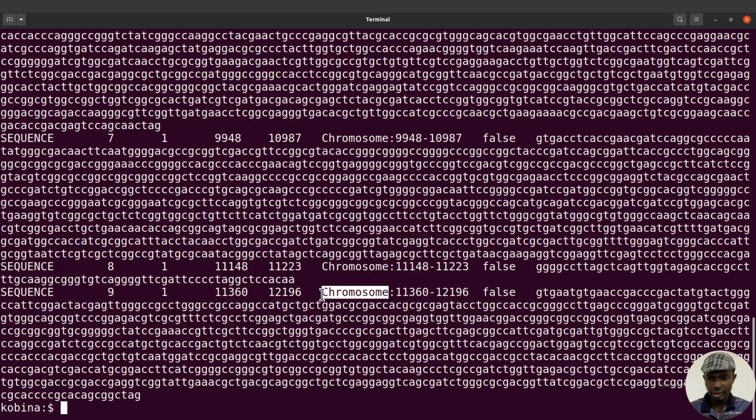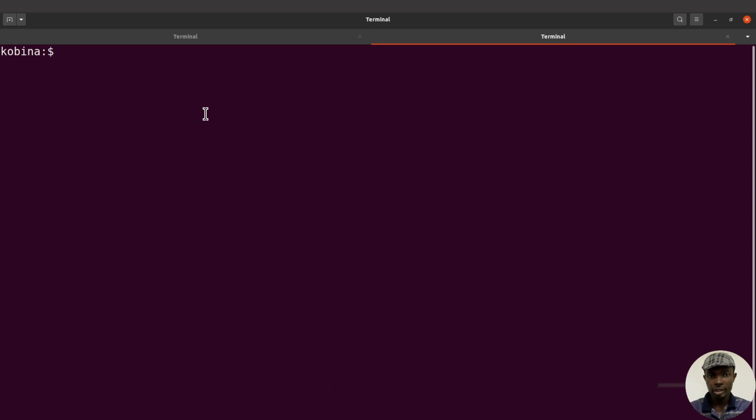We have this. Now let me just open another terminal, that will be better. So let's take a look at our reference sequence. All right, so ls into data, we have this. So let's go ahead, data slash AGY99.fasta.